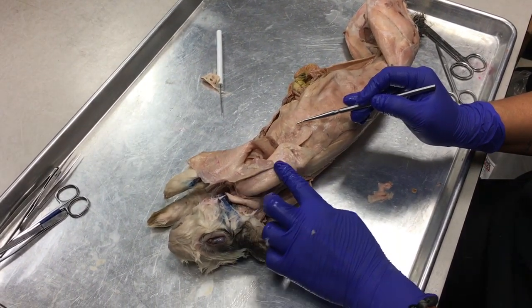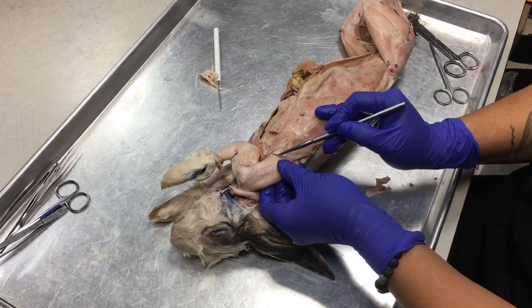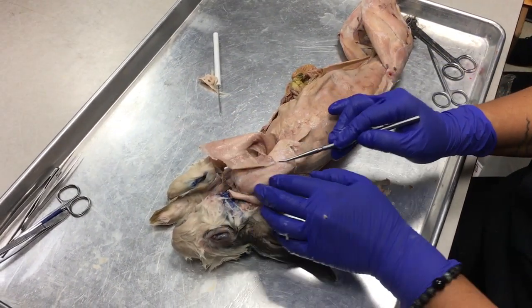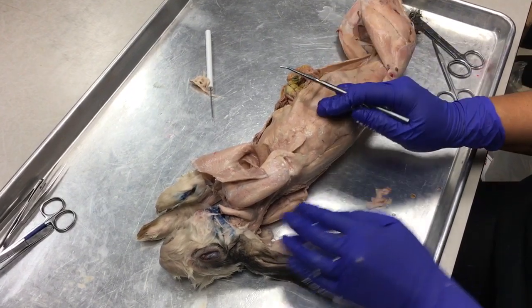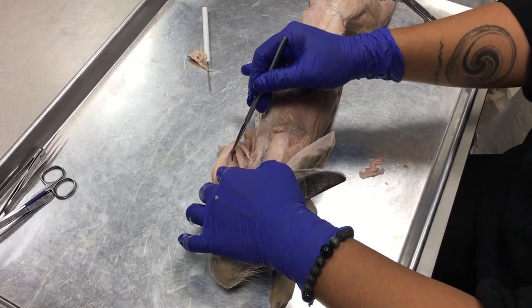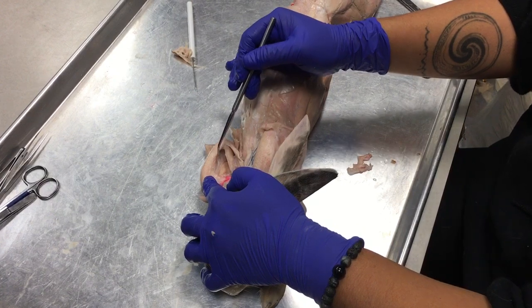The top group is called the supraspinatus. Okay, it's over, it's super to the spine. The bottom is called the infraspinatus, underneath. And this little wedge is called the teres major. Okay, I don't know what that means. All right. Now, if you flip the shoulder over and look underneath, there's muscle on the underside of the scapula as well. This muscle is called the subscapularis.